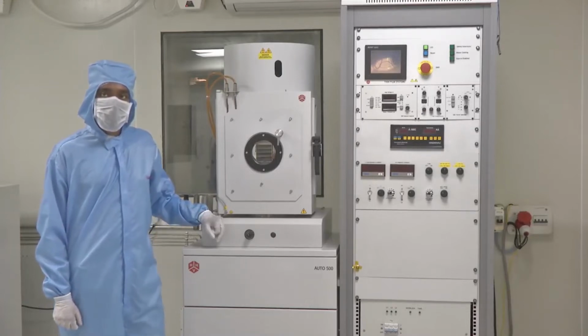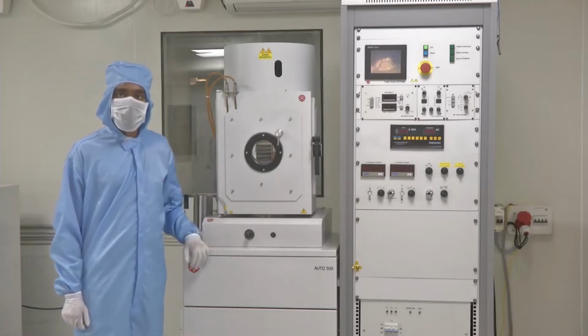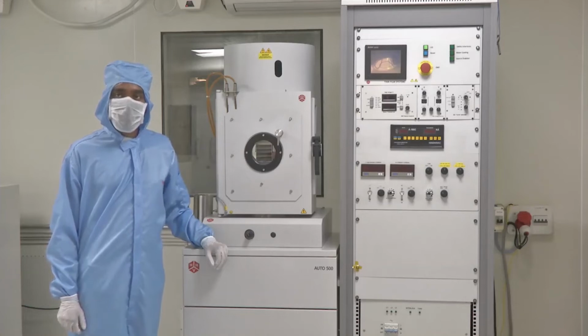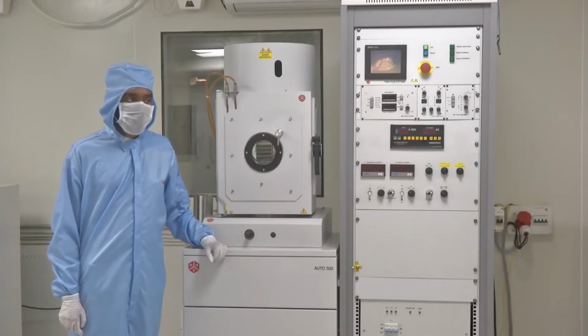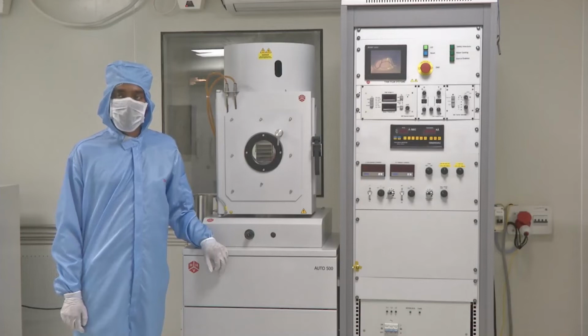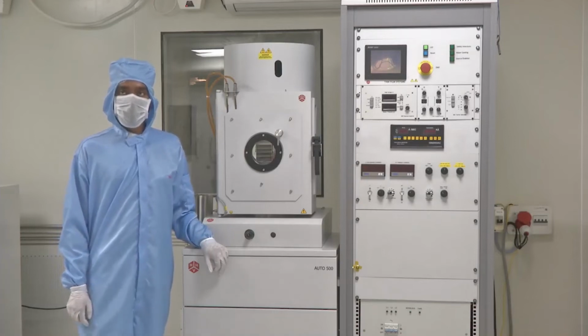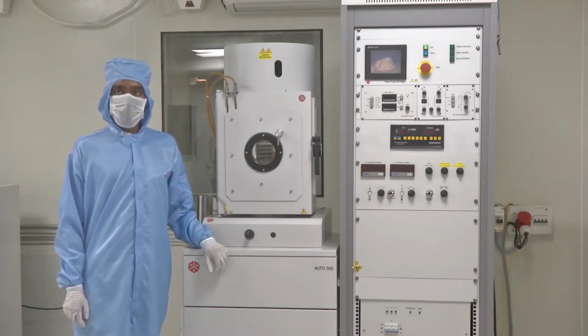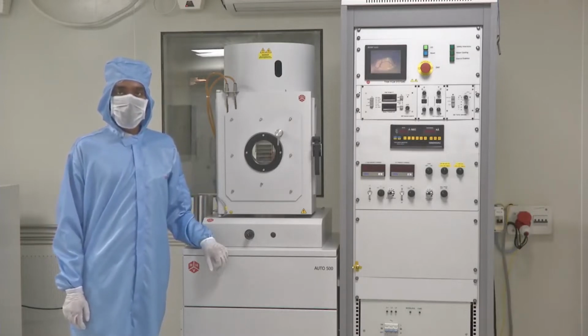So we heat the metal which is placed in a crucible using the electron beam so much so that it evaporates and gets deposited onto the substrate. That's why it is called E-beam, electron beam evaporation, which means the electron beam results in evaporation of the desired material onto the substrate on which we require the material to be deposited. This system leads to very high quality thin films of very high uniformity. So let us see how this system first can be switched on.